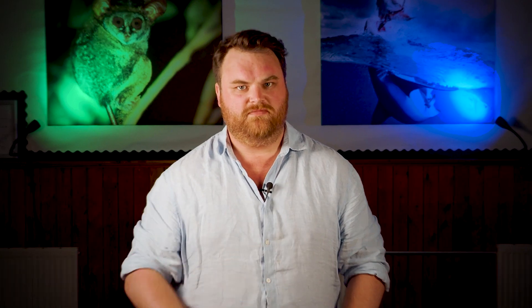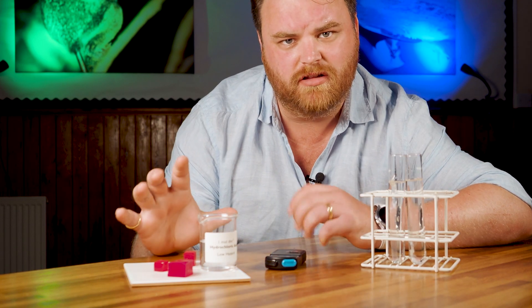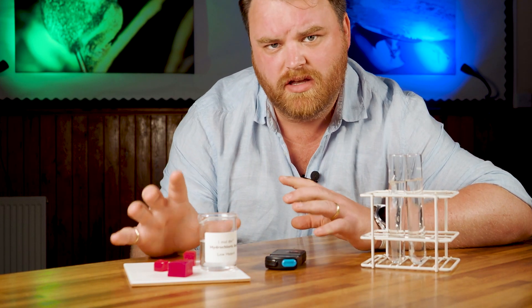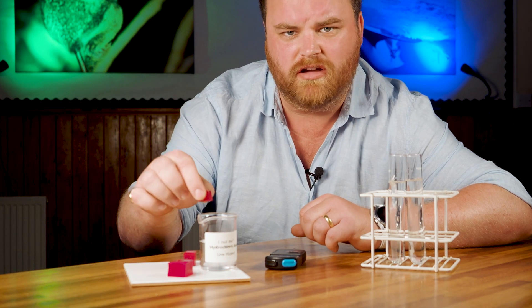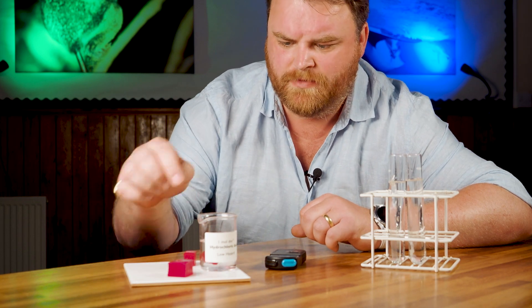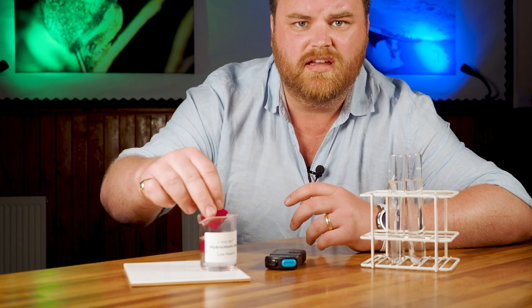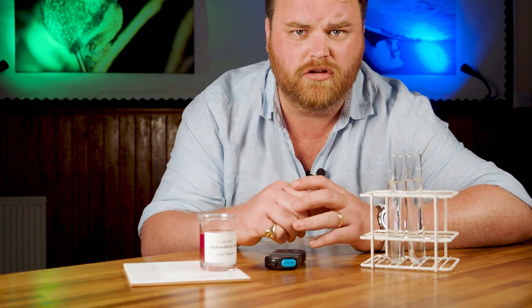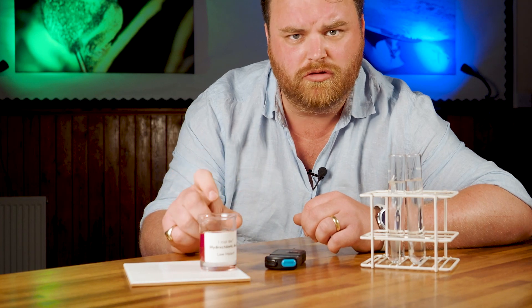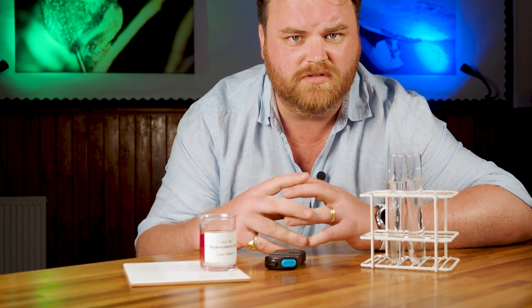Let's have a look at that in non-living systems first. Here we've got three blocks of agar gel that have been coloured with phenolphthalein — that's a pH indicator — which we can submerge in hydrochloric acid. As the acid diffuses in, the indicator will turn colourless. I've changed the size of the cube to alter the surface area to volume ratio, and we can see that the smaller the cube, and so the higher the ratio, the faster diffusion will take place.